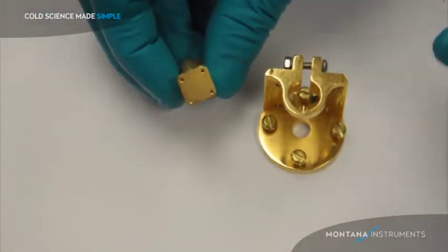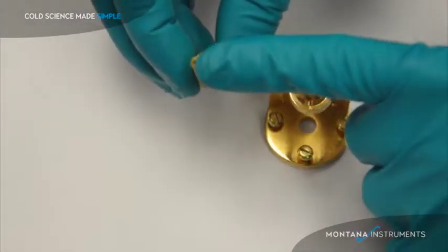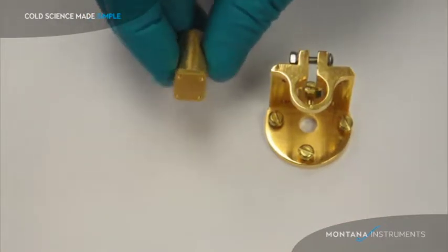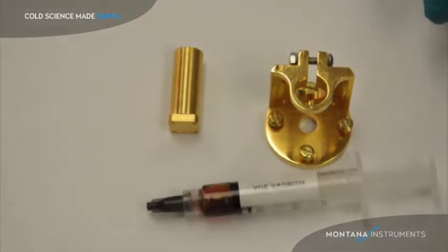The end of the sample post has a flat surface on it with bolt holes for clamping your sample on the surface. The holes are there for you to create a grip plate that would hold your sample firmly down. You may also hold your sample to the flat plate using a thin layer of GE varnish, such as the one provided with your system.